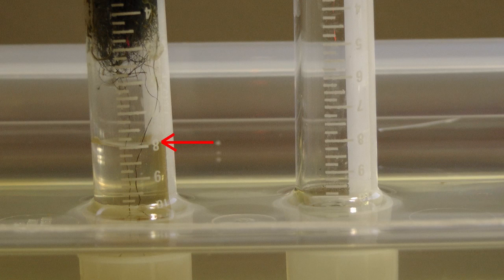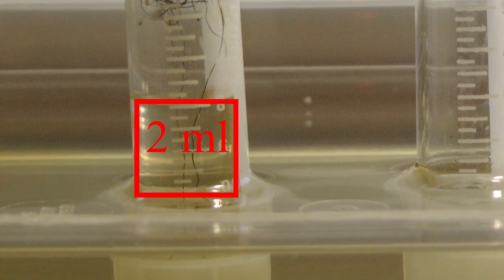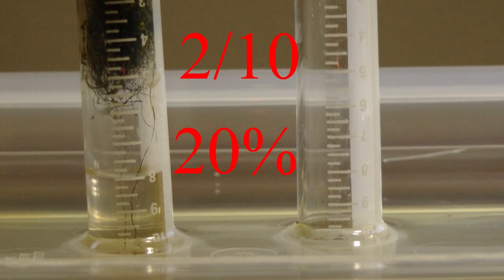Of the original 10 milliliters of air in the tube, 2 milliliters had been replaced by water. This water represents the volume of oxygen that had been removed from the air, 2 milliliters. According to our results, oxygen makes up 2/10 or 20% of Earth's air, a good approximation.